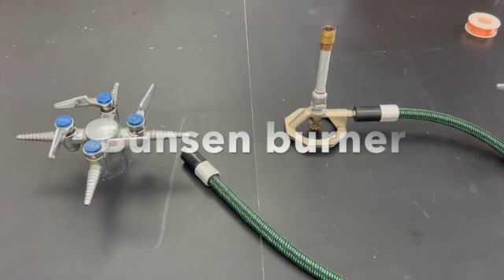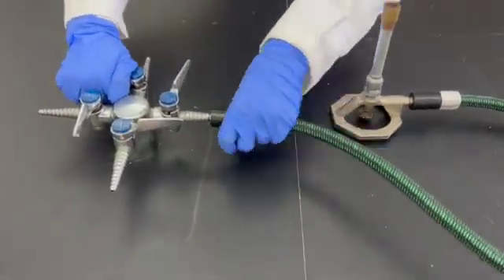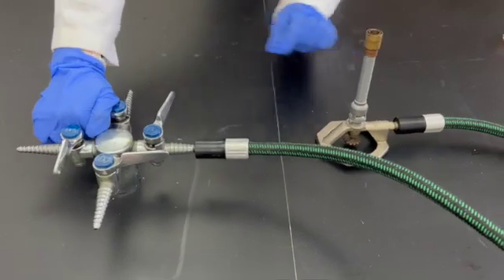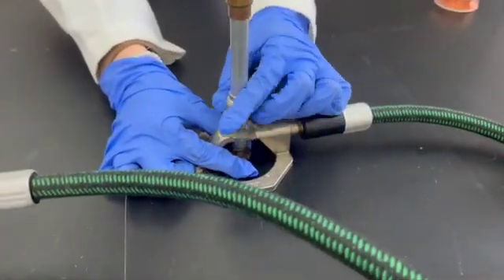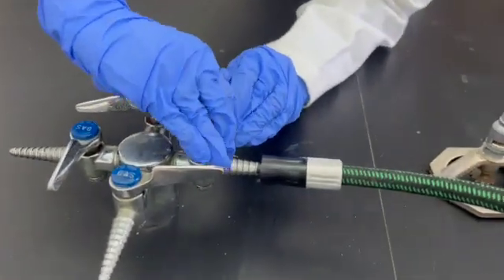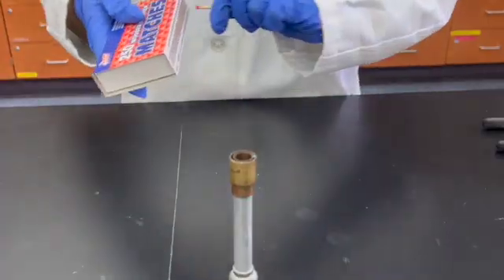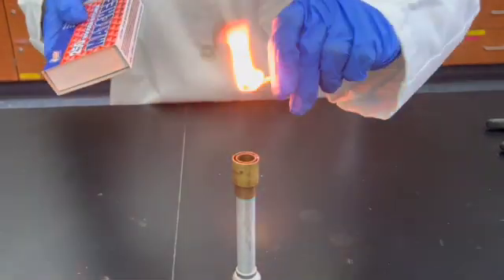Start by taking your Bunsen burner and attaching it to the gas nozzle. Adjust the top and bottom of the burner so that the air holes are slightly open. Allow gas to come into the burner by turning the handle so that it aligns with the spout. Now that there is gas coming out of your burner, you can use a match or a lighter to ignite a flame.